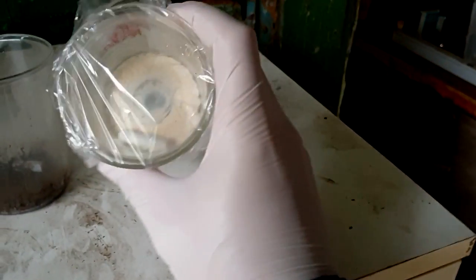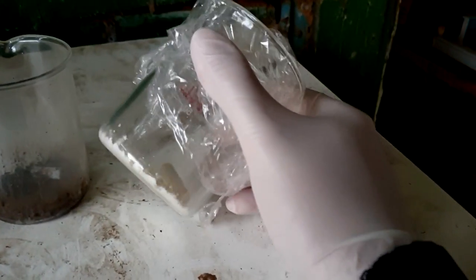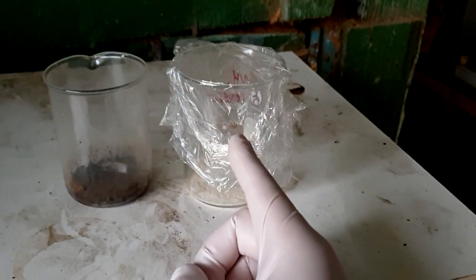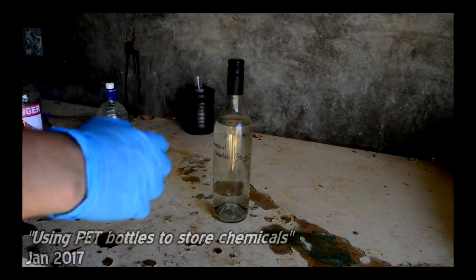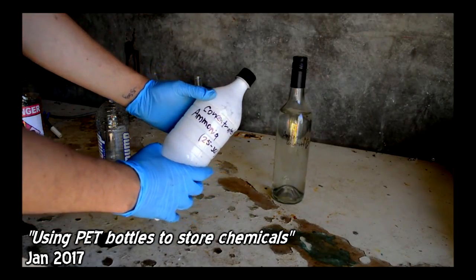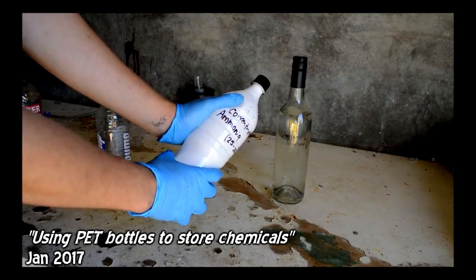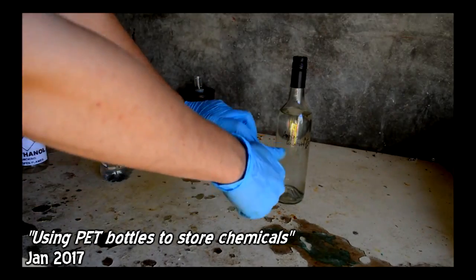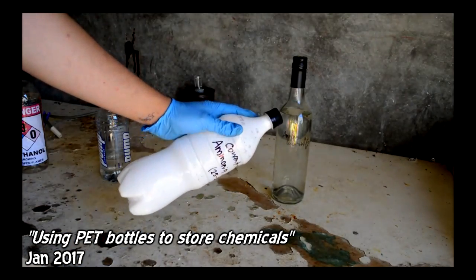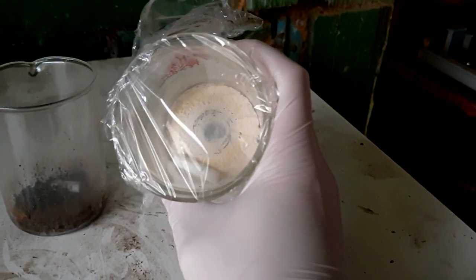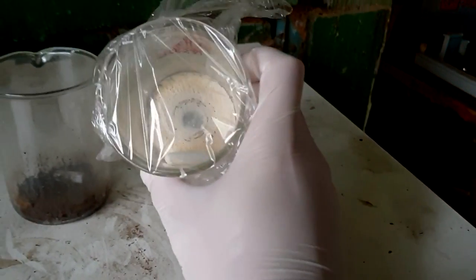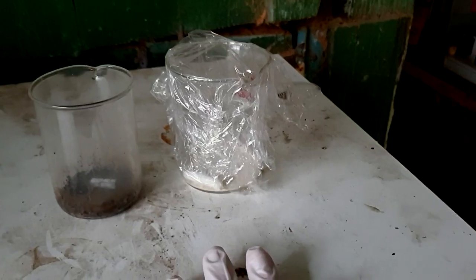At first, I was pretty confused, because I was like, wow, come on, it can't be that impure. But, then, I thought back, I thought, what's the history of this ammonia? If we think back to quite a while ago, this happened. And, so, it sat there for a few months, and when I went to get it out, it looks like this. So, what this has done, the ammonia has hydrolyzed the ester linkages and made ammonium terephthalate with the bottle. Now, the bottle is very weak, and I'm lucky I caught it, because I think another week or two, and this bottle would have split. So, this is ammonium terephthalate. It's obviously been pulled from the bottle it was stored in. I didn't know that was in there. Yeah, so we can't use this ammonia for this experiment. So, these hours have been wasted.